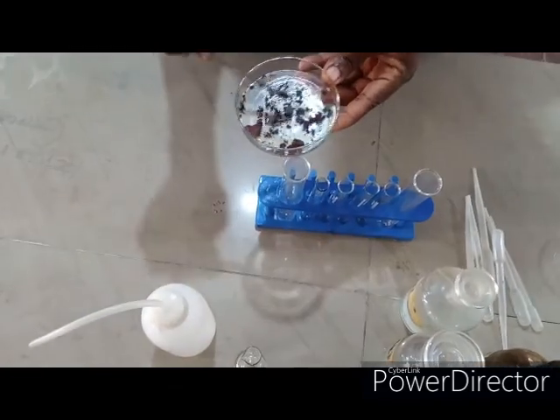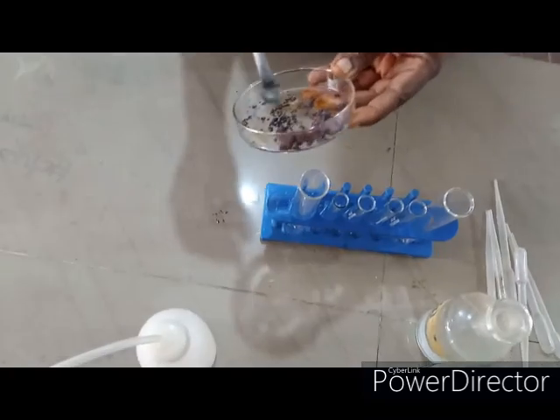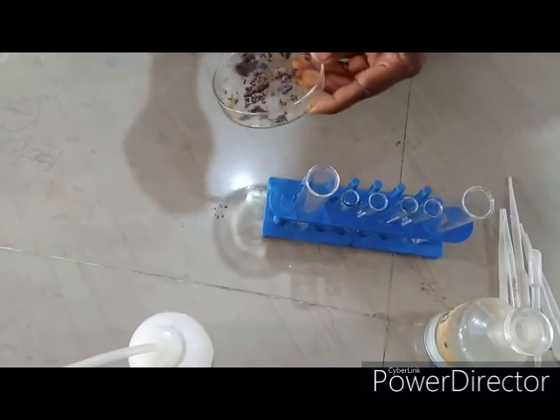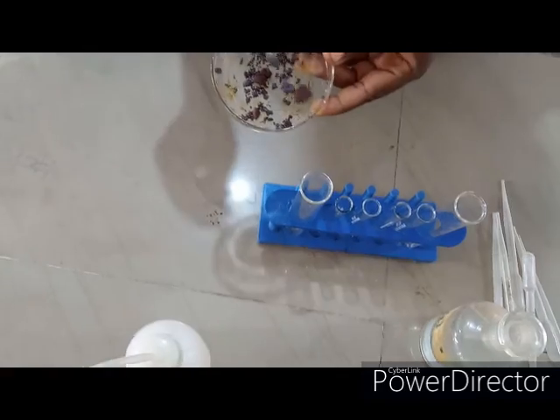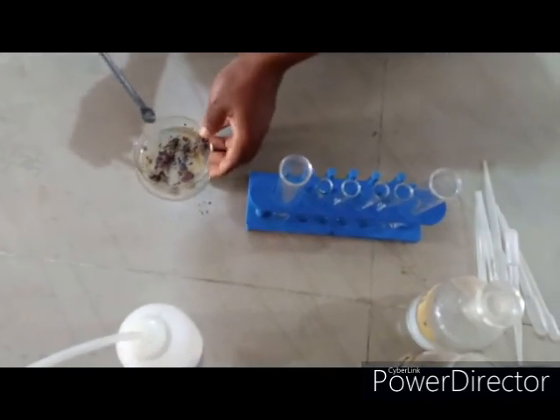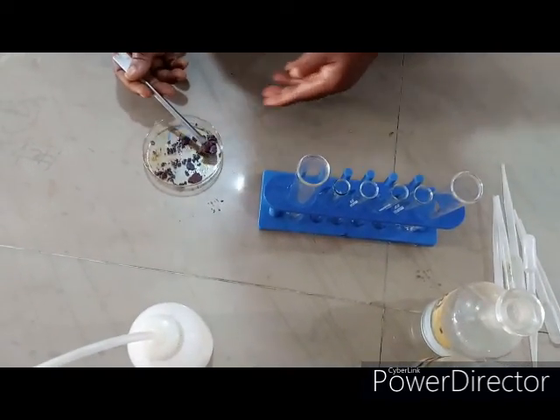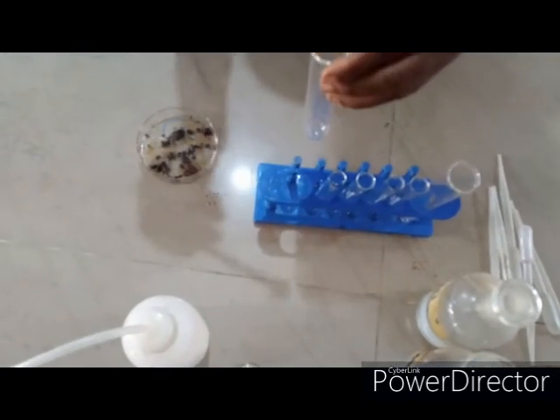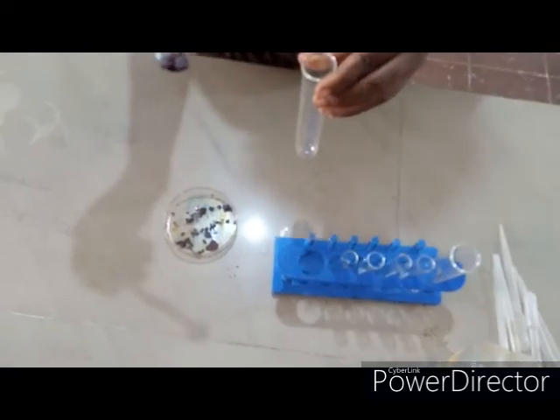In today's class, we have another simple salt. As you can see, what cation can you infer from this salt? It is a reddish brown salt. I'm sure your guess is correct — it likely contains iron 3 plus. Let's carry out some tests on the salt to identify the cation and the anion. The apparatus we need for identification of this salt is our measuring cylinder.